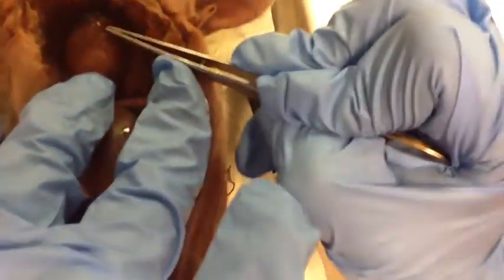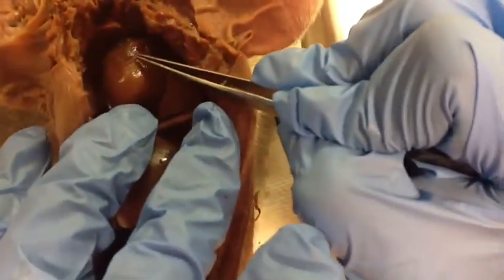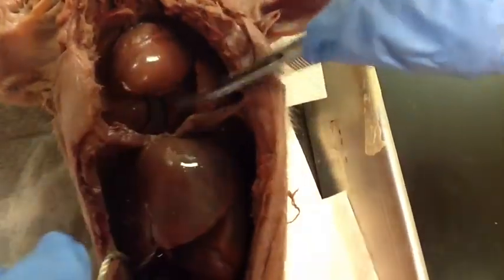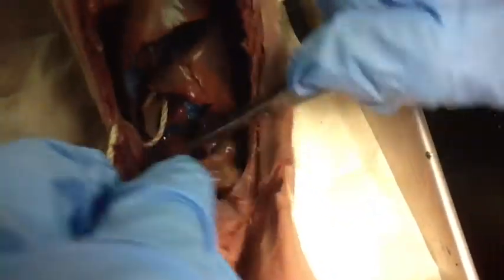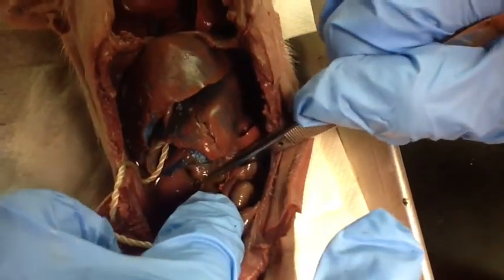Moving along the heart, you find the coronary artery along the side of the heart, which is here. And then underneath the heart, we lift up and we see the vena cava, this large blue vein. The dorsal aorta is difficult to see, but is underneath. This is the posterior vena cava. Traveling down through the abdomen, it's quite difficult, but we see the right renal artery.